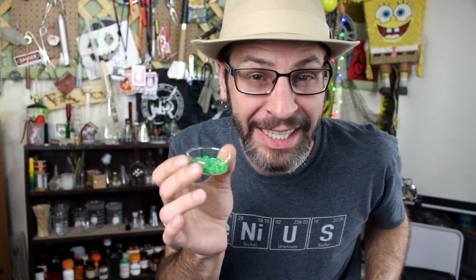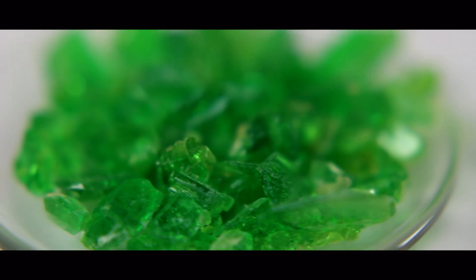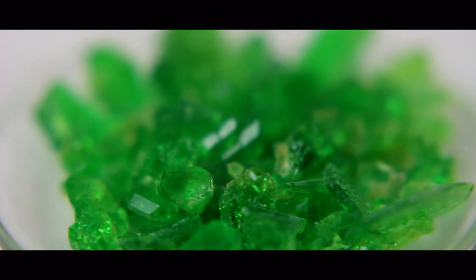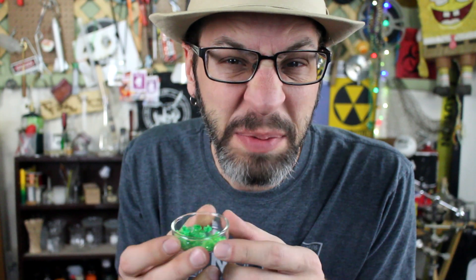They're finally done. Oh yes, we have pirate crystals finally! Now honestly, this stuff really looks like kryptonite — which, now that I think about it, that might be a problem for me.